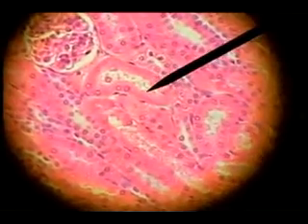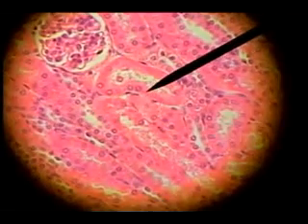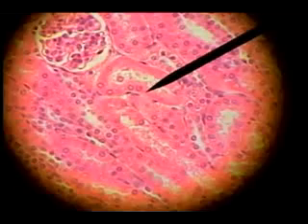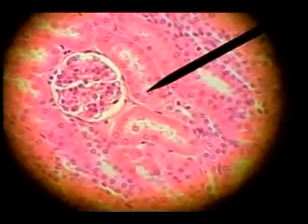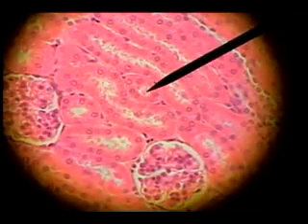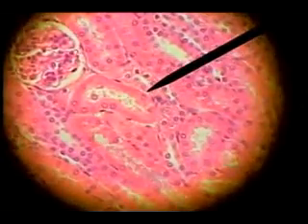These are tubules, and these darker or more reddish stained are proximal convoluted tubules made up of cuboidal shaped cells. Here's one here. This would be sort of an oblique cut, and this would be more of a circular or transverse cut, cuboidal cells. Proximal convoluted tubules staining more densely pink or eosinophilic.